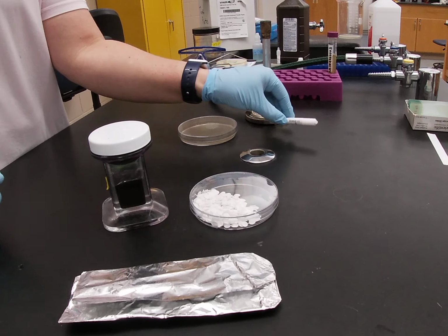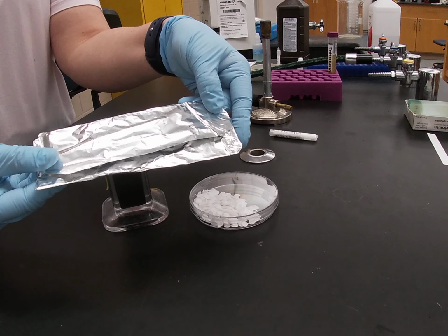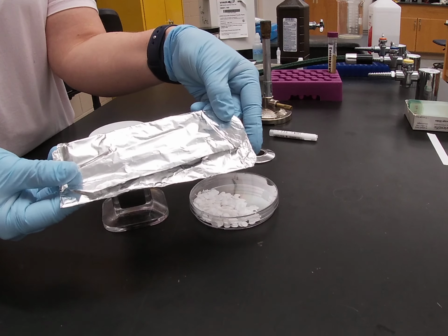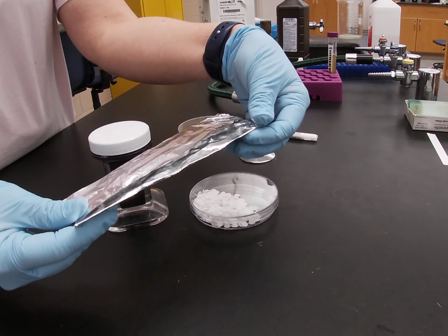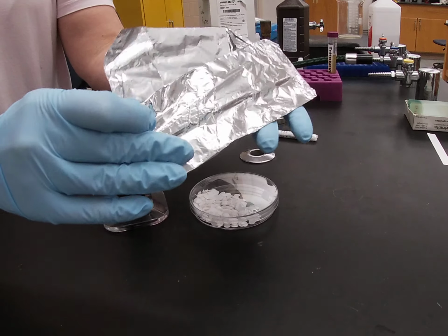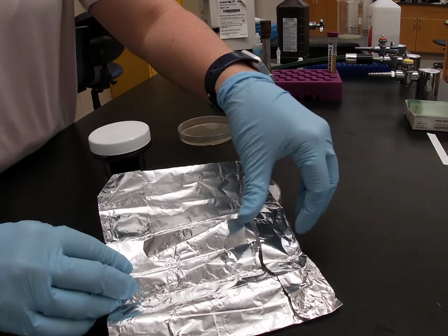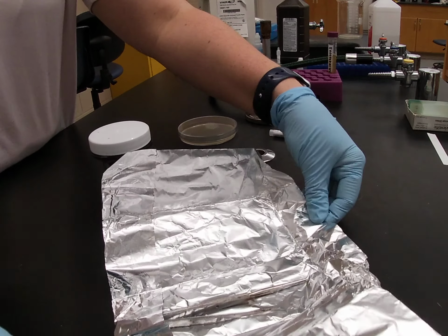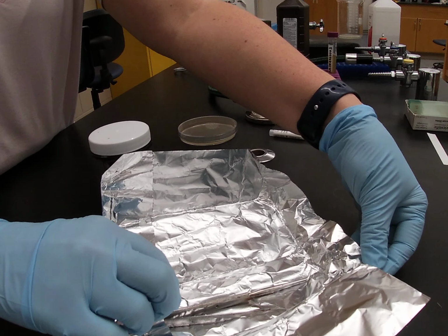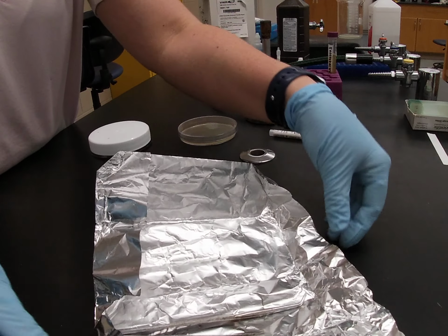So in our antibiotic lab, you are given a foil packet that has been sterilized. These have been taken through the autoclave, so everything on the inside of this packet is completely sterile. You want to very carefully open up your packet, being careful not to touch the inner portion of the packet. Leaving the inside of it sterile, you now have a sterile place where you can put your instruments down when you are not working with them.